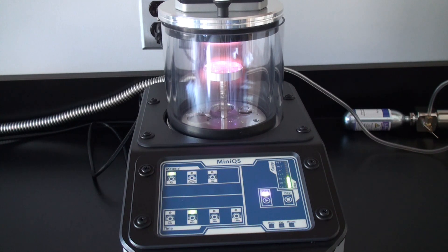Once you set what material and the time, and you make sure that you have argon turned on and your vent gas turned on if you're using a vent gas. The system can use anywhere between 1 psi of pressure for the argon and nitrogen up to 14 psi, but I really recommend that you use 4 to 6 psi.